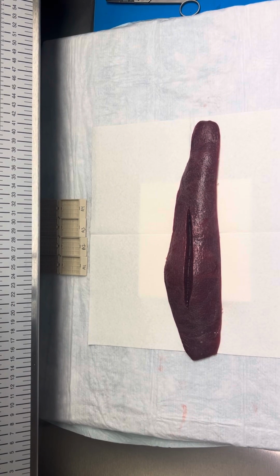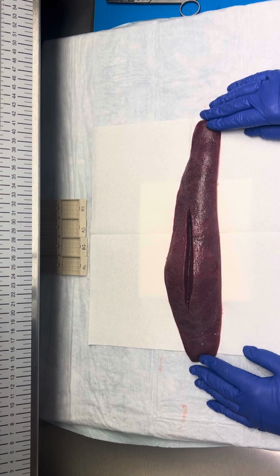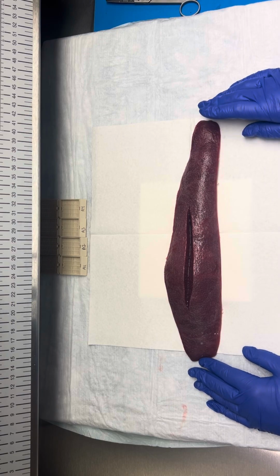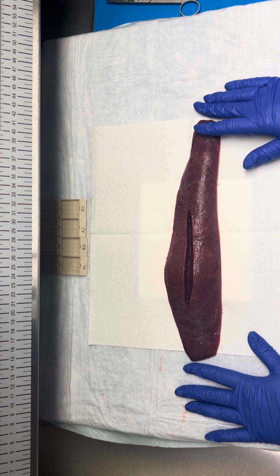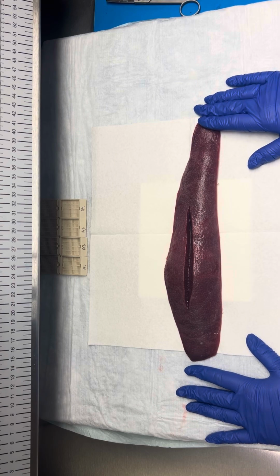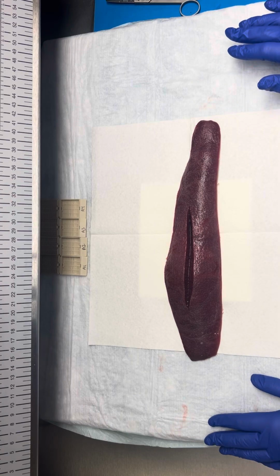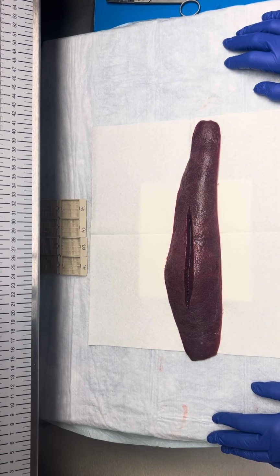I'm going to cover a spleen prosection with you if we received a splenectomy for trauma or laceration. So we have an animal spleen here to represent our splenectomy. These are a lot larger in comparison to human specimens, but the anatomy and the gross appearance of the animal spleen is very, very similar. So this is what we're going to use to do our spleen prosection.